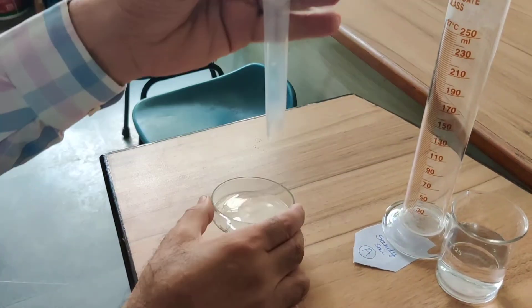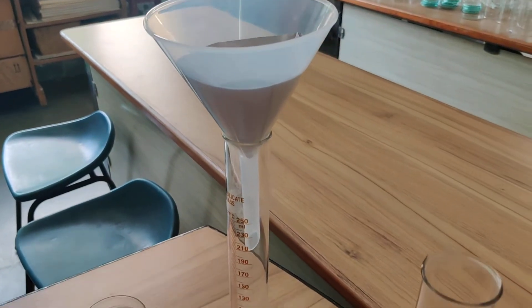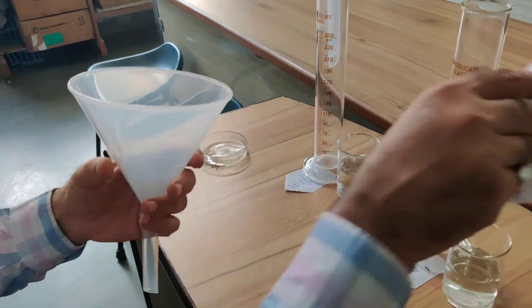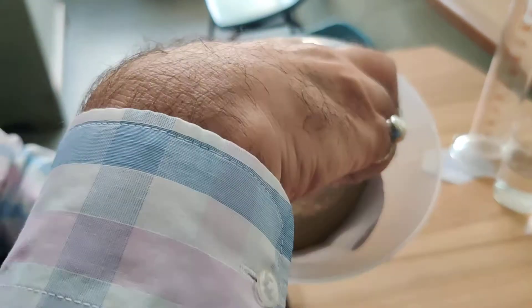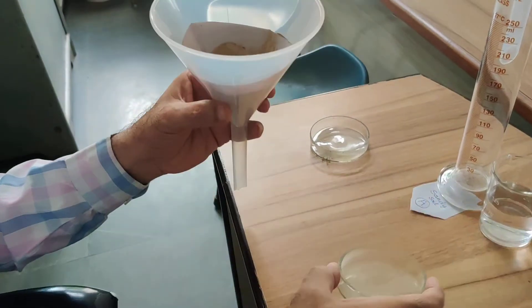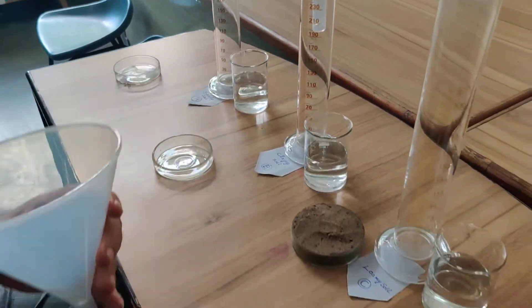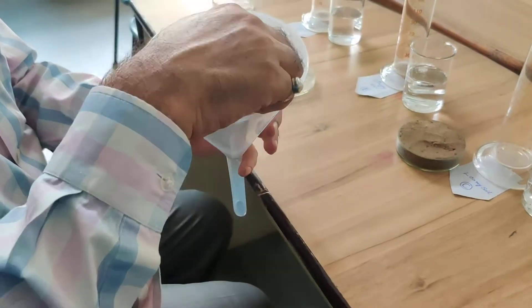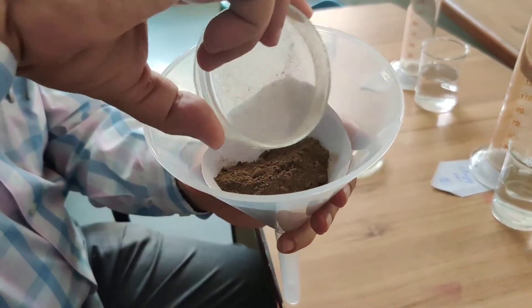This is 100 gram sand — we will fit it here in the first funnel. Then we take the second funnel with a filter paper cone and 100 gram clay — keep it here. This is the third funnel with filter paper, and this is loamy soil. Now we have to study their water holding capacity or percolation rate.